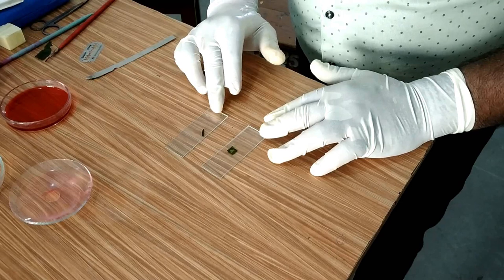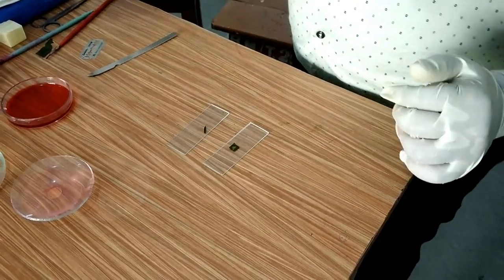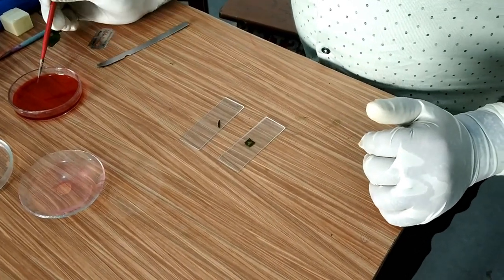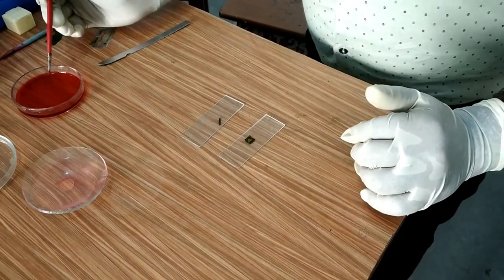These are the two alternative techniques to prepare a slide of stomata. After collecting these two epidermal peels by these two different methods, I will pour safranin stain which is red in color.